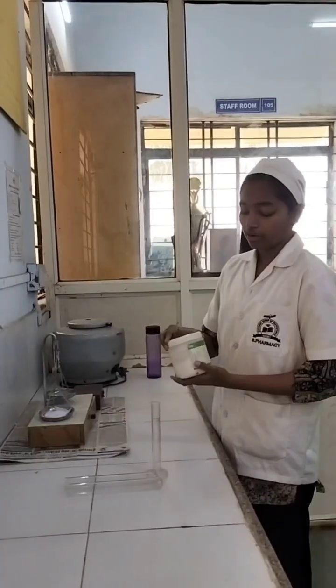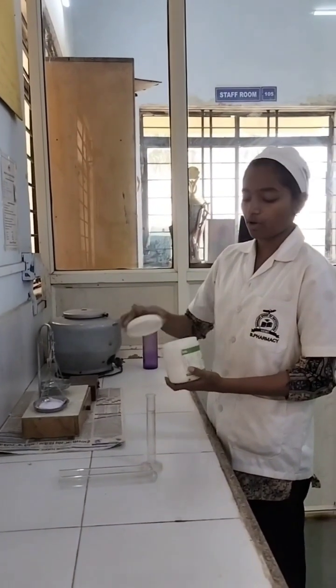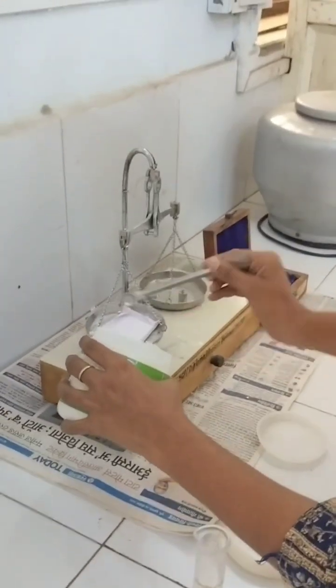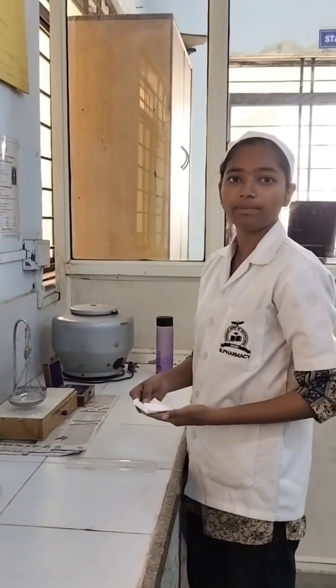Let's start the process. Let's weigh the powder sample.